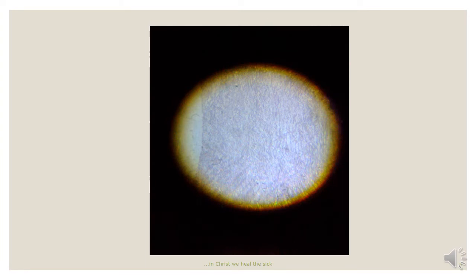This slide was stained mainly with the Van Gieson or the elastin stain. So in this slide, we can map out the lumen of the artery and then the tunica media. You can note the tunica media by the wavy appearance of these black fibers going up and downwards. This wavy appearance characterizes the elastin fibers that are stained with the Van Gieson stain.